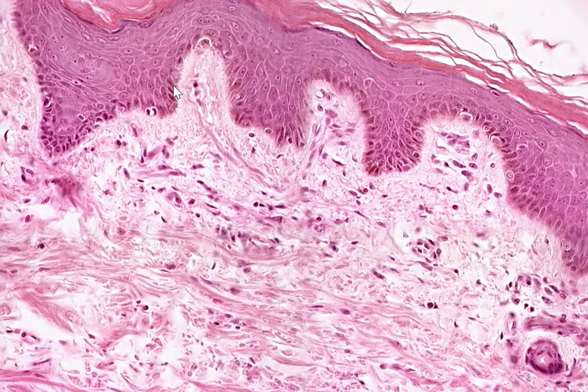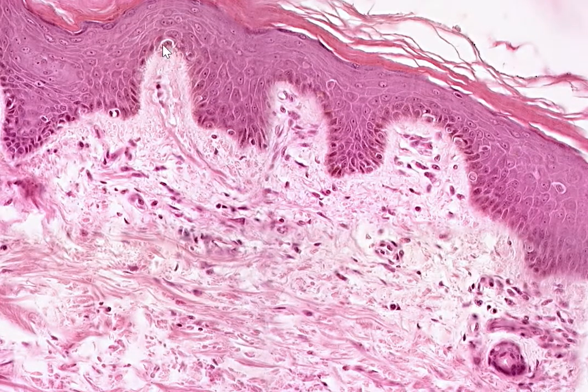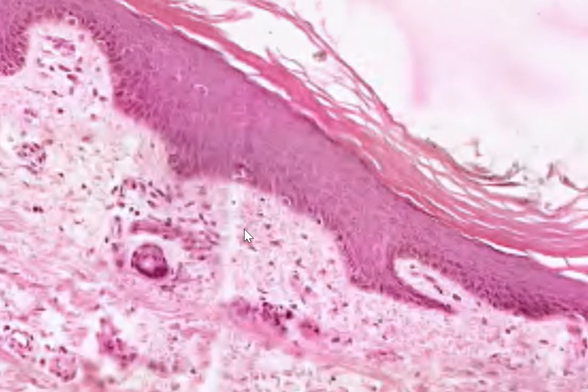And then we have a little vacuole around the outside of the cell, which is actually an artifact which occurs due to tissue processing. I think this also might be a melanocyte. We have a more grayish cytoplasm and then a white kind of vacuole around the cell. And this occurs due to tissue processing.